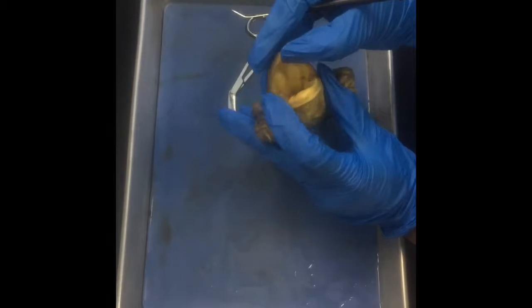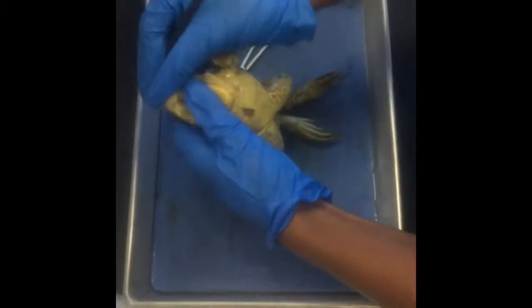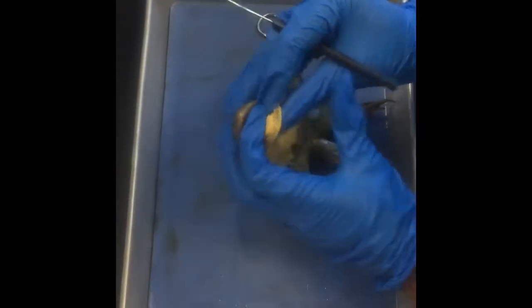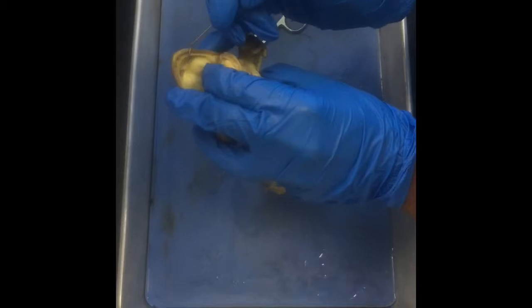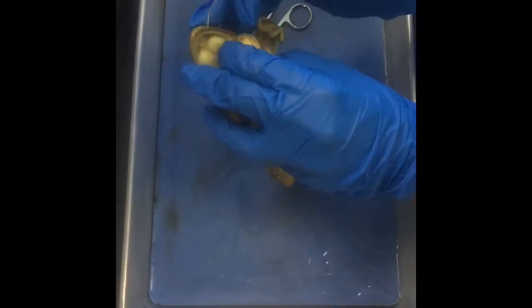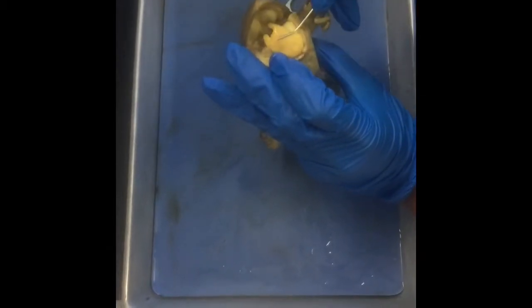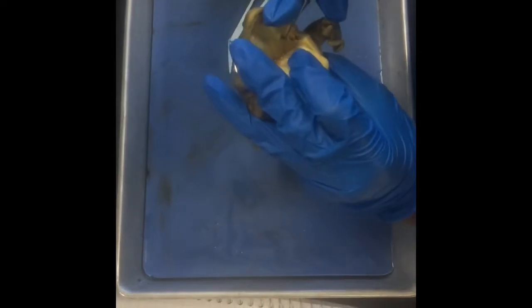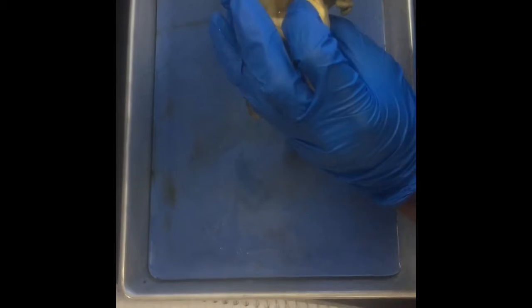Alright, so here you have the mouth of the bullfrog. Here, right at the roof of the mouth, are the internal nostrils, which conduct air into the mouth from the exterior nostrils. Immediately next to the nostrils are the vomerine teeth, which are used for holding the prey. From there you have the tongue of the frog, and it's used for catching the prey. And at the very back of the mouth, you have the esophagus, which conducts food through the anterior body cavity to the stomach.